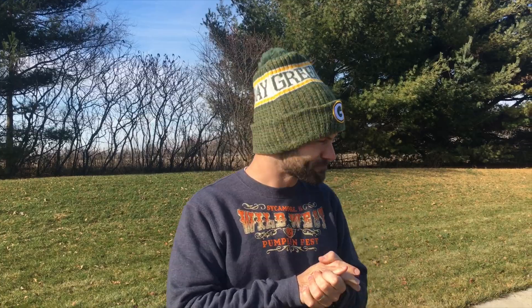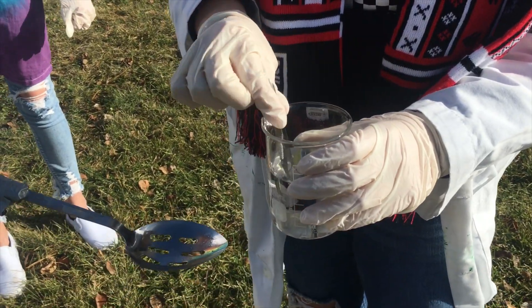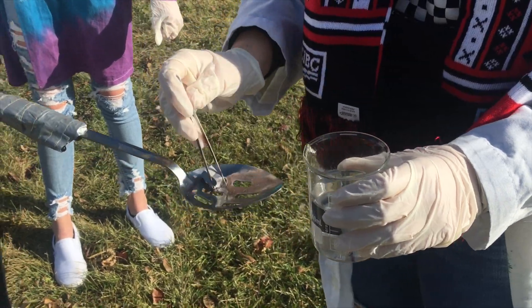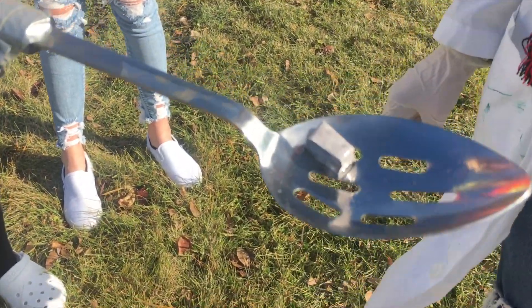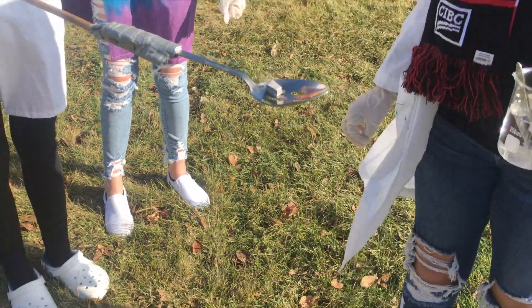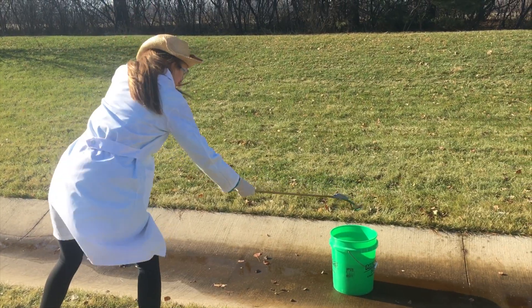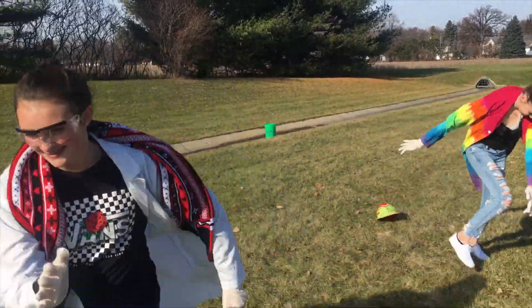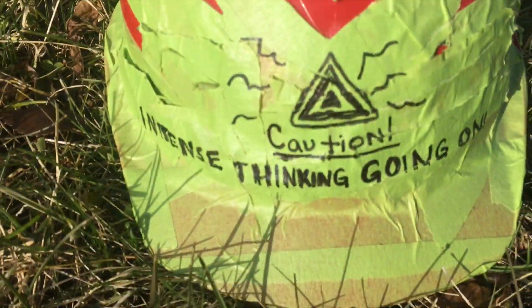Here are the steps. Number one: remove the sodium from the beaker. Number two: place the sodium on the handle of the spoon, or on the circular part. Step three: drop it in the water. Step four: run like a crazy person. Easy. Now let's watch.